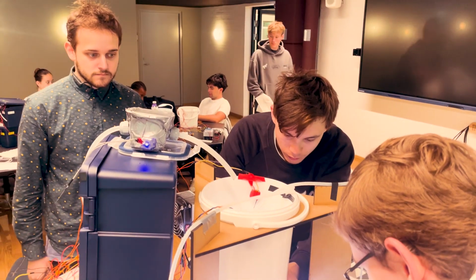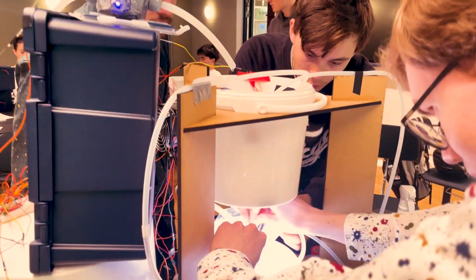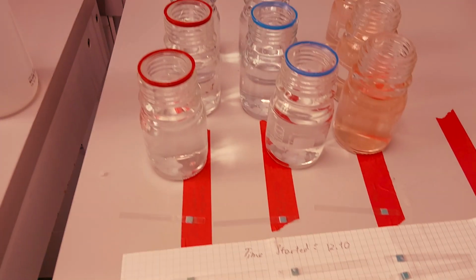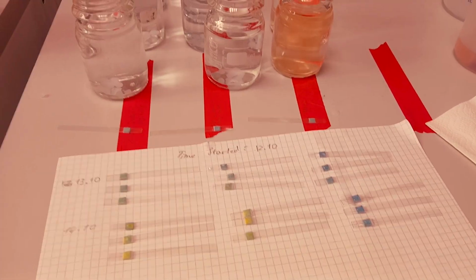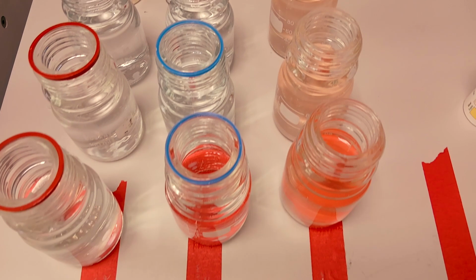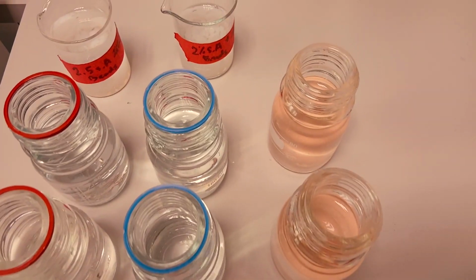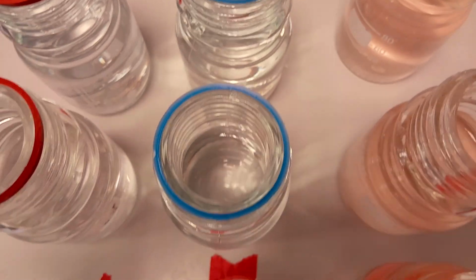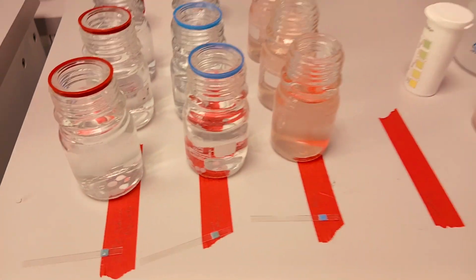Now, the mathematical model showcases that the free algae would theoretically filter ammonium a little quicker. Contrastingly, our experiments using colorimetric ammonium strips showed significant ammonium reduction within 2 hours in bead-treated setups, but none with equivalent free algae. Overall, the incorporation of algae beads for efficient ammonium removal was a successful innovation strategy for modulating and controlling ammonium filtration in our system, and allows for system compatibility across aquatic species with higher ammonium sensitivity.